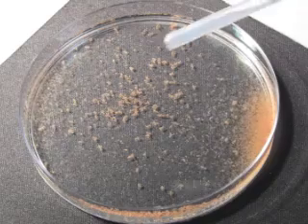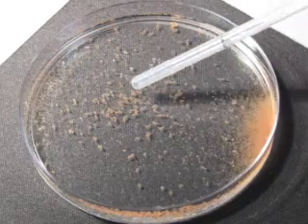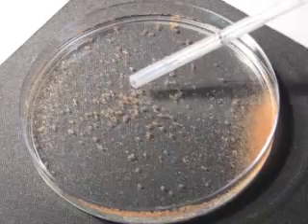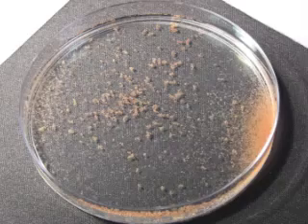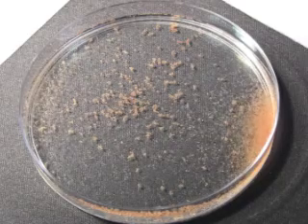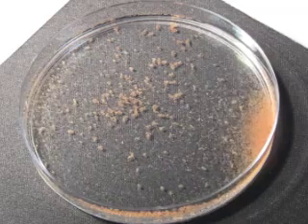You'll also notice there are some non-moving brown dots — these are Artemia cysts. They are the egg shells that the Artemia have emerged from. This will become much more obvious when you're up close and looking at the petri dish yourself.